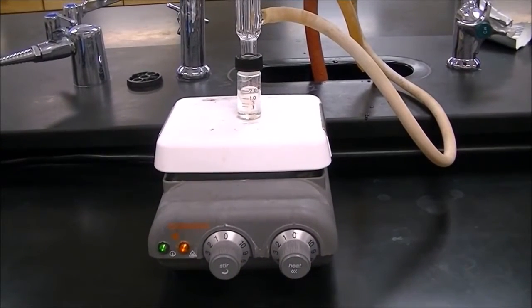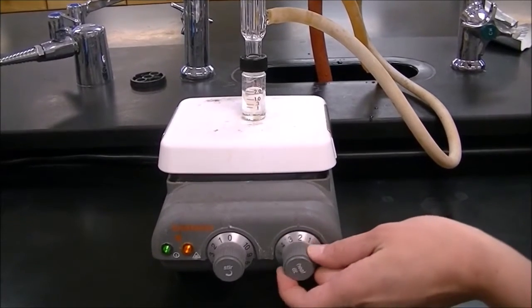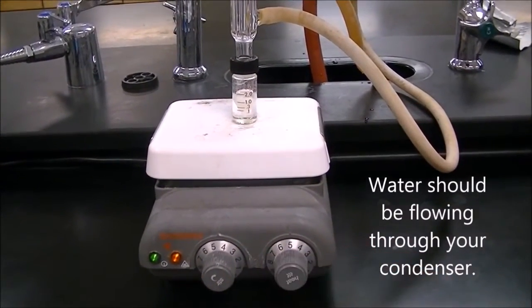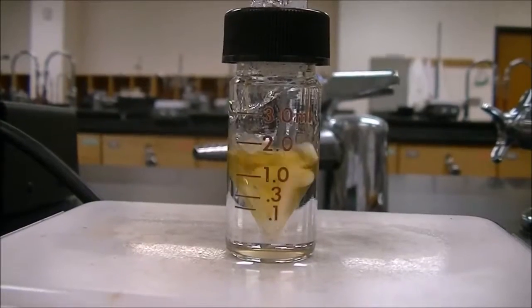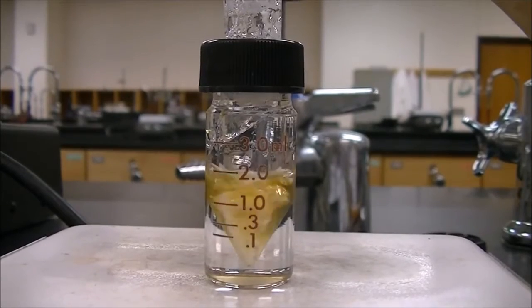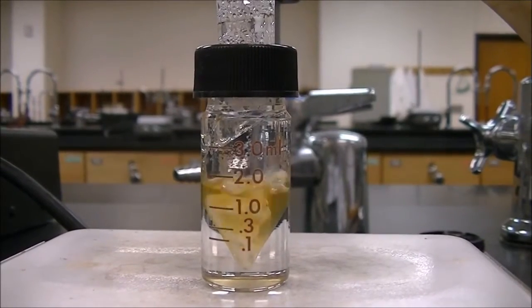Begin refluxing: turn on the heat and the stir. While refluxing, you should notice that your solution turns a yellow-orange color and that it starts to condense down the conical vial.